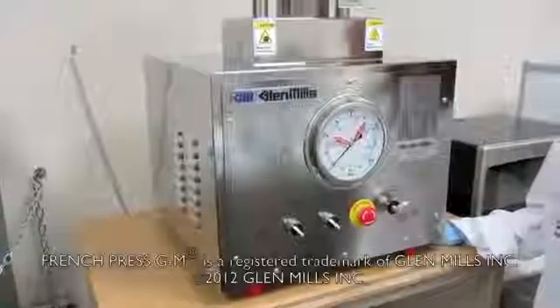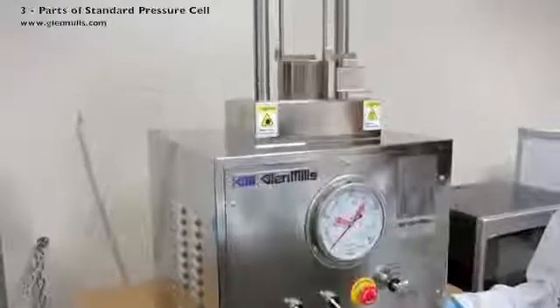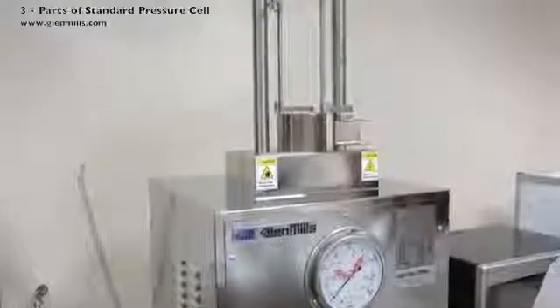This French Press has considerable safety improvements over earlier models, but you still need to be properly trained in its use and be sure to always work safely.